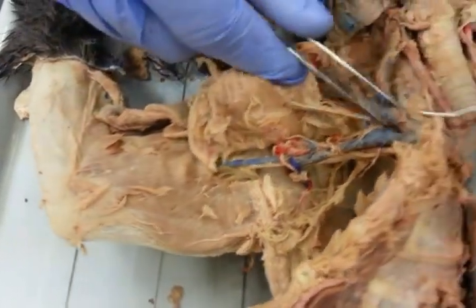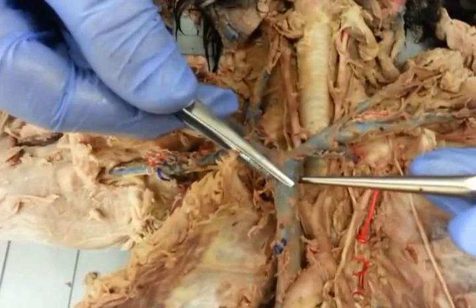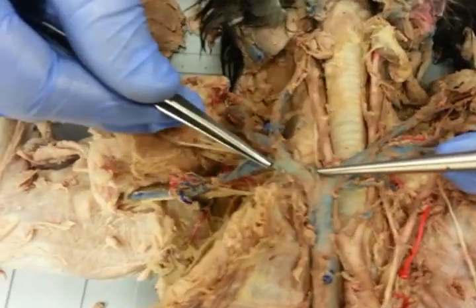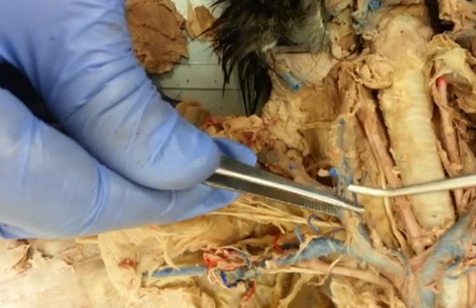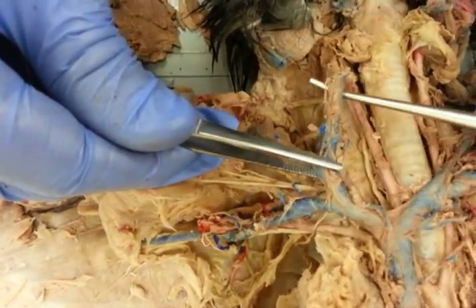All right. So going back up, just to orient, we have cranial vena cava, we have right brachiocephalic, and then we have right subclavian. But if we go this way, we're going to have the bijugular trunk. So this short segment right here before the bifurcation is going to be the bijugular trunk, and that's going to give off two different portions.